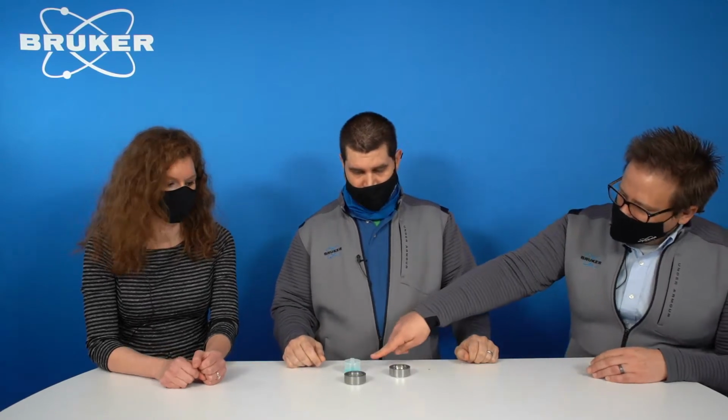Okay. Now, it does look like you have liquid in this one, though, right? Yes, I'm not sure which liquid's in there, but we do have something blue. And then on the bottom, is it some sort of very transparent material? Yeah, so that's a film that we use. There's a lot of different films on the market. There's Mylar, there's Prolene, there's Kapton, there's a whole bunch of different films. And there are reasons why you pick one film over another. It could be the type of material that you're running so it doesn't attack the film, or it could be what element you're looking at. Each film will absorb X-rays. And so if you're looking at lighter elements, there are films that are better for those lighter elements like sodium, magnesium, and stuff like that, versus heavier elements, where it doesn't really play a factor.